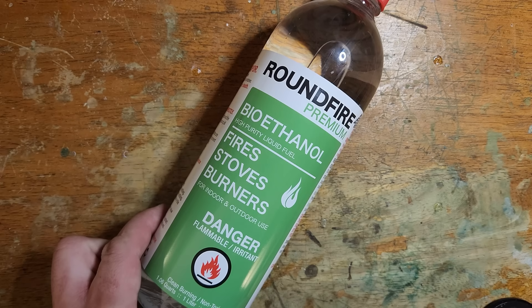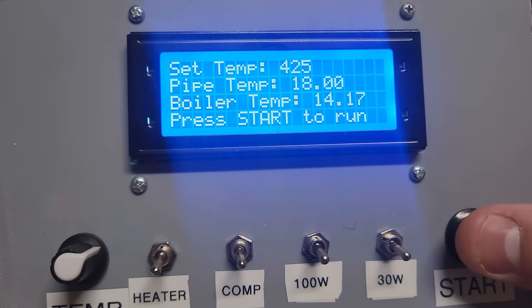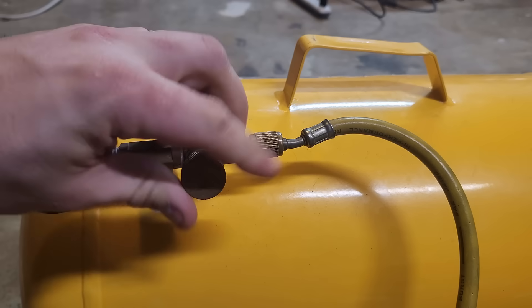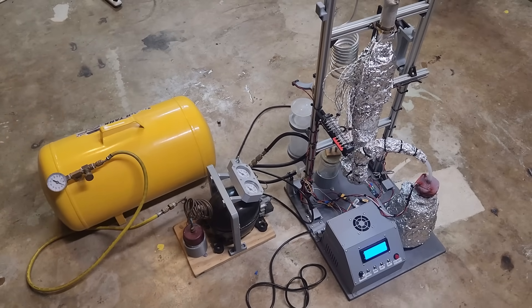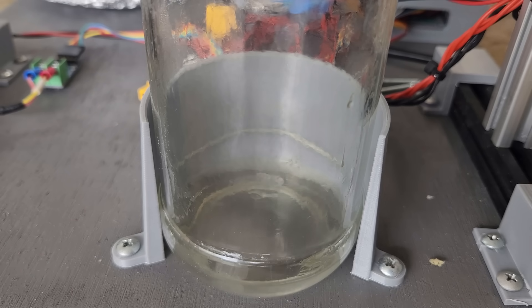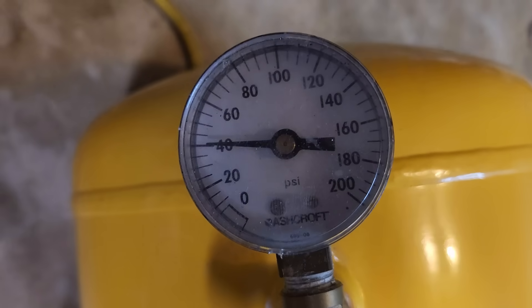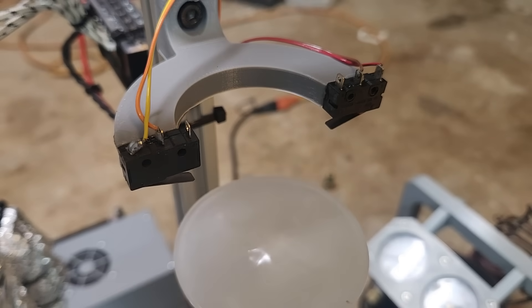I swapped the hardware store alcohol for bioethanol, which claims to be 96% ethanol with no weird or smelly additives. After this I started getting consistent ethylene production. To start the generator, you just plug in power, set the temperature with the knob, and hold the start button for one second. The display reads out catalyst temperature, boiler temperature, and elapsed time. After hooking up the compressor and holding tank, I could watch the syringe moving up and down as ethylene is generated and pumped into the tank. Starting from 0 psi, after about three hours it's up to 40 psi — around 103 liters based on the tank size.